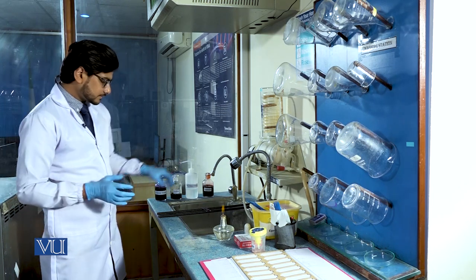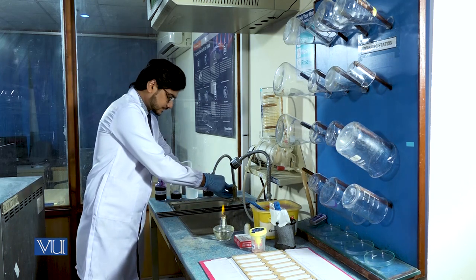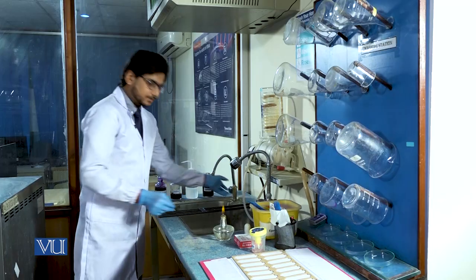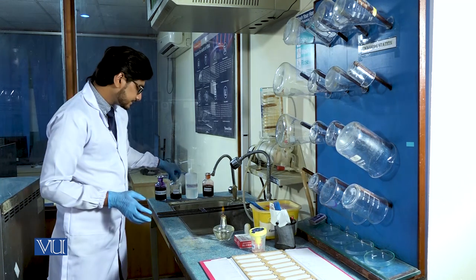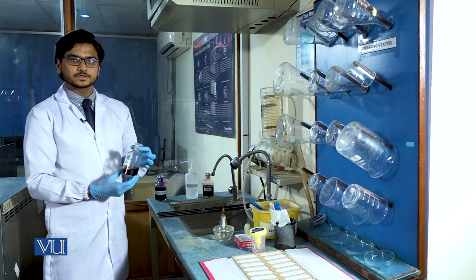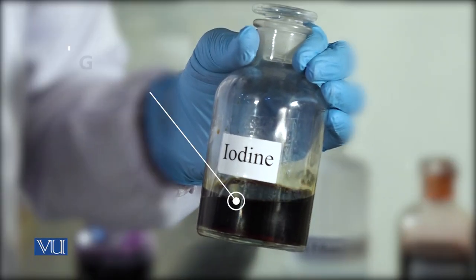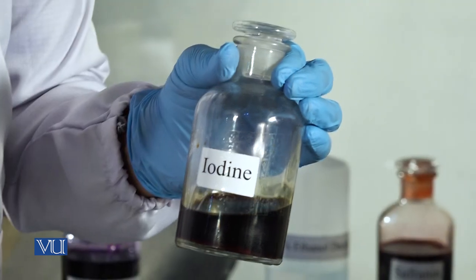After one minute, we wash the glass slide with tap water. Then we apply the second dye which is Gram's iodine. Gram's iodine is also known as the mordant dye and it is used to fix the bonding between gram positive bacteria cell wall and crystal violet.